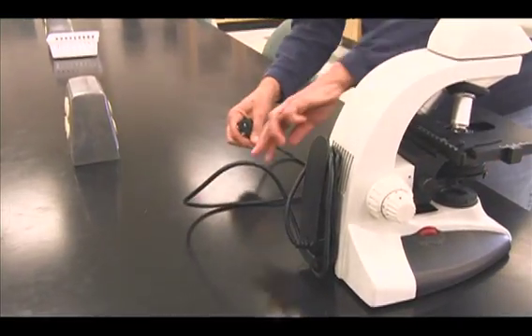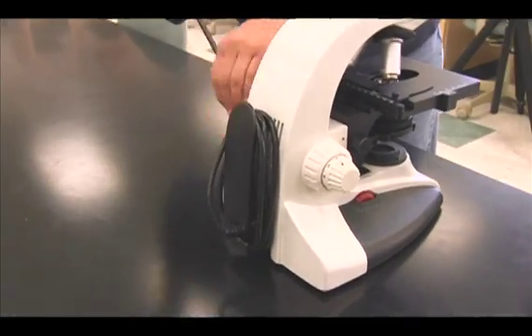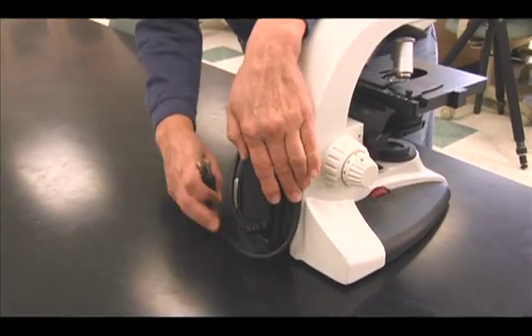Unplug the microscope by the plug and wrap it into the cord holder. Never pull on the cord to disconnect.